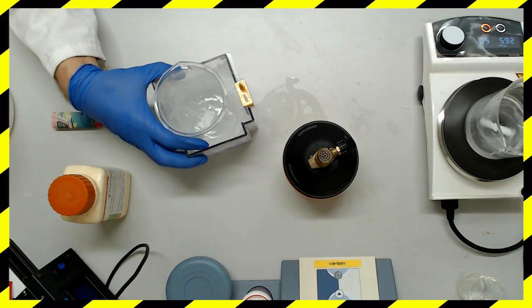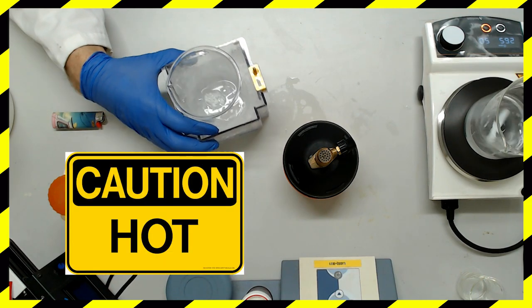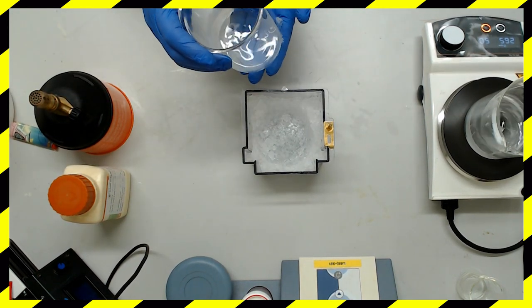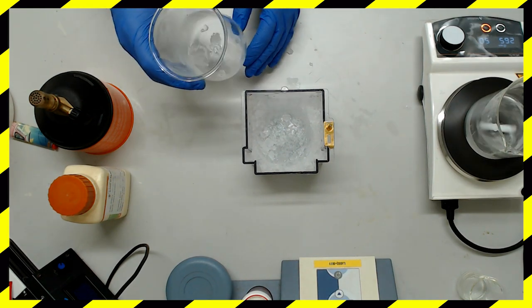Back to how nasty potassium hydroxide is - the addition of water is extremely exothermic, so you may need to cool the vessel while dissolving your pellets. According to the MSDS, potassium hydroxide can spontaneously combust if moisture gets into the bottle, so screw that up tight and don't spill water in there.